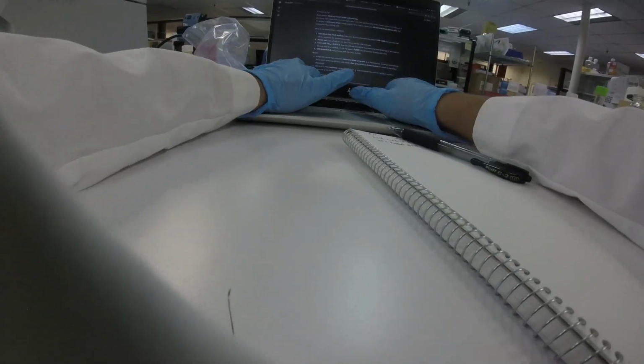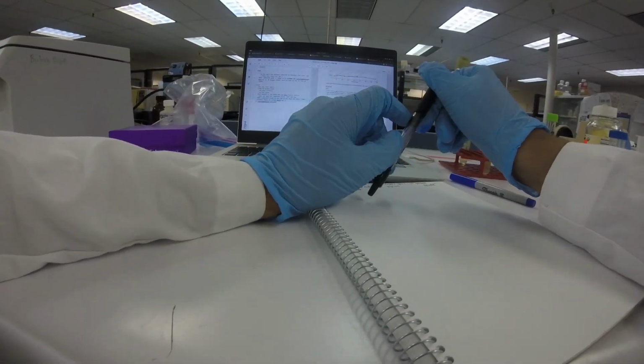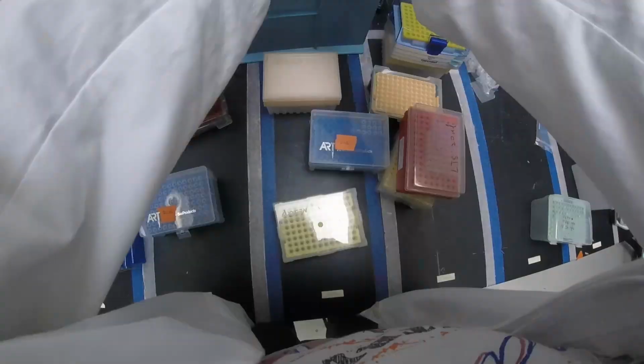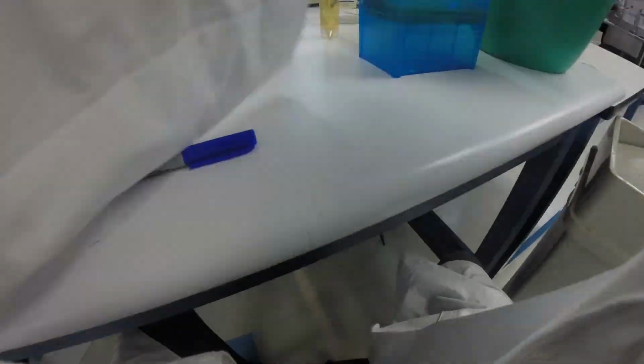I did incubate some of that yesterday, but the results were just so terrible. The pellet of cells was so small that I kept sucking it up during the discarding the supernatant step. And even if I tried to just pour off the liquid, it would leave way too much. But I do have a pretty nice protocol written up. I'm pretty confident it's going to work because Derek gave me a protocol for doing it, and he washes it in just normal DI water.